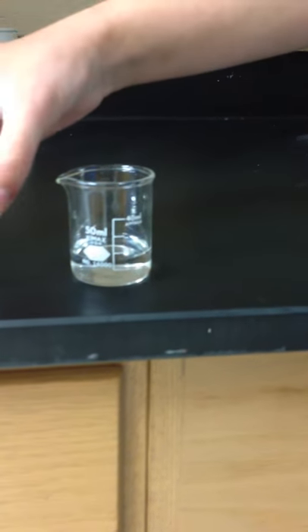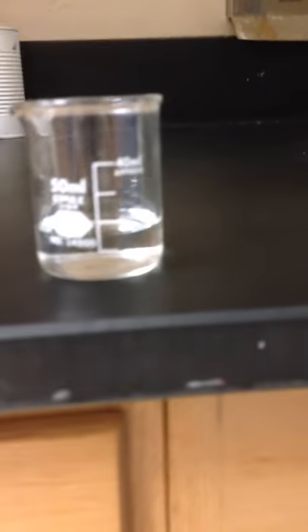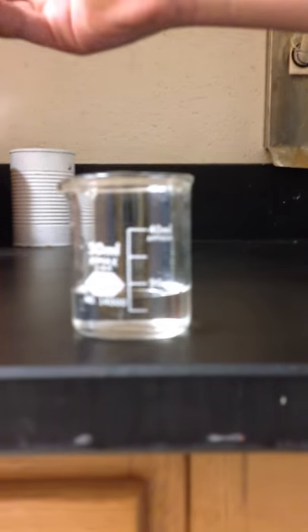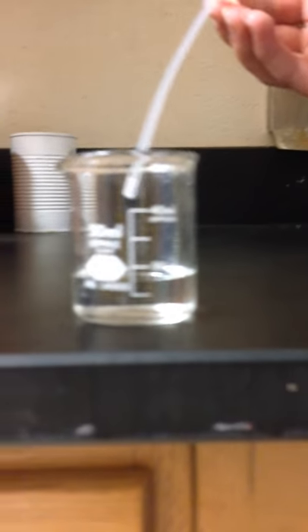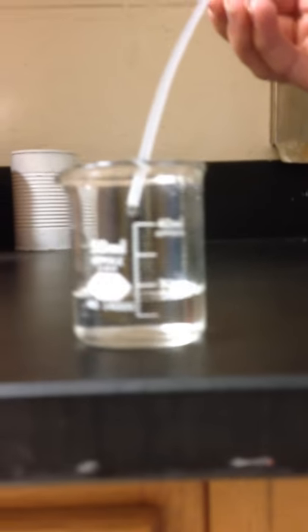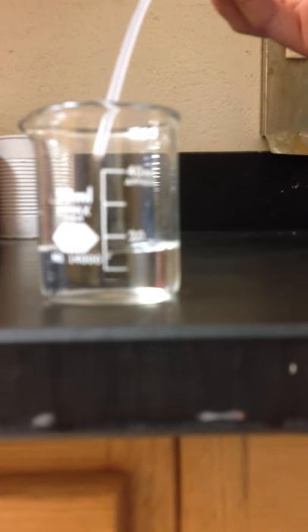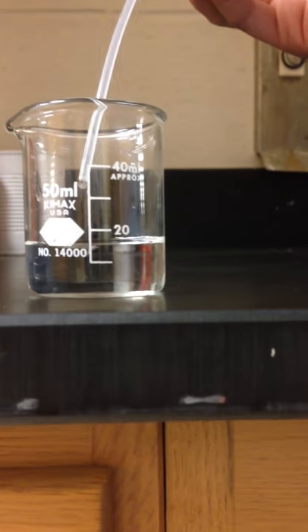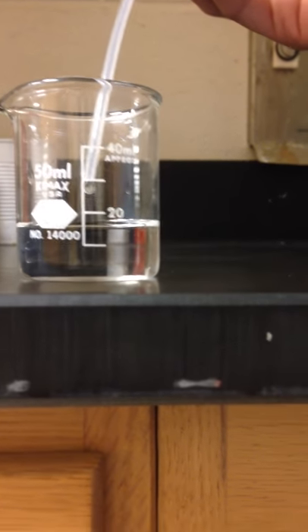And then, to get the exact amount, you'd have to use this. You squeeze slowly at the top to get exact drops.